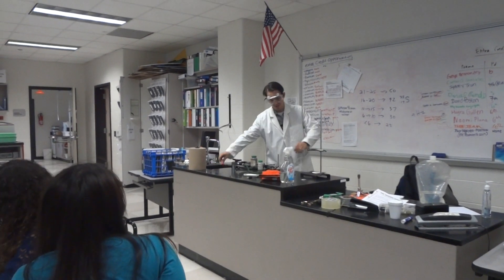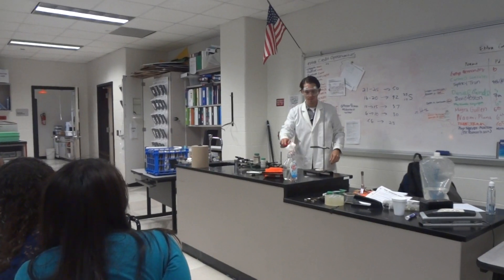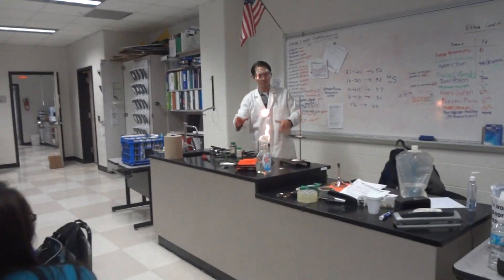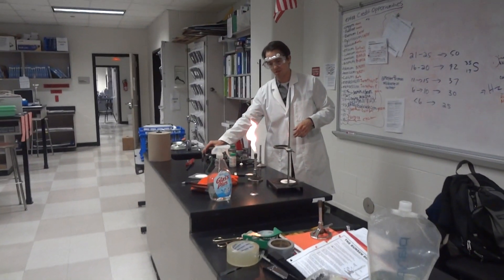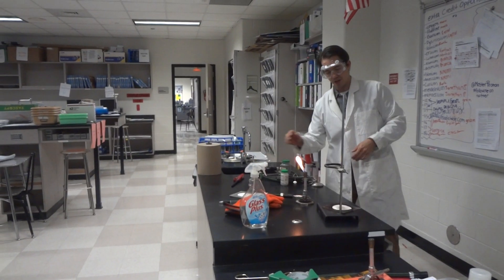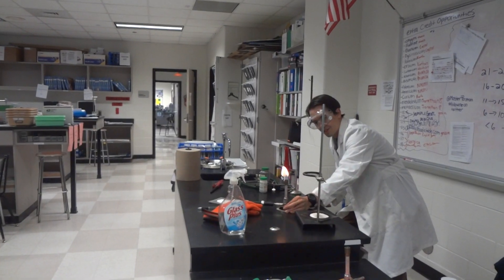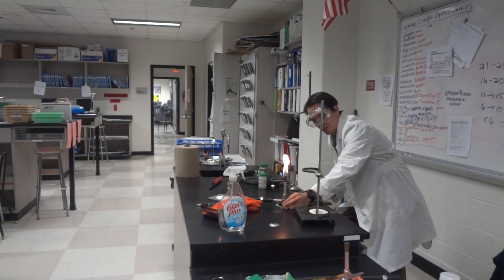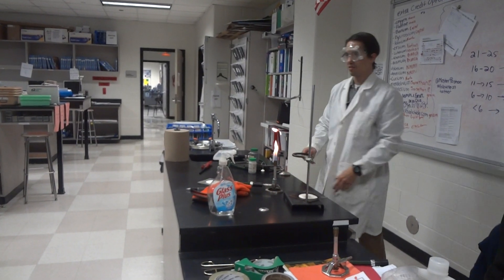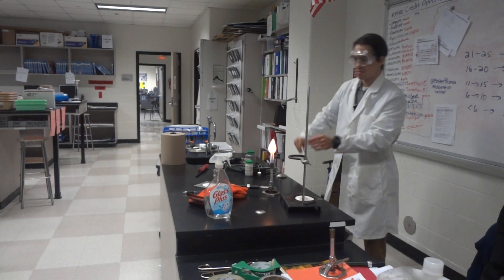Let's open this — the gas will come out. You see some sparks because we had some residual iron from the last demonstration, from the last class. An open flame — let me adjust it. There's our flame. The hottest part of the flame is actually the blue part, not the yellow part. Because blue has more energy than yellow.